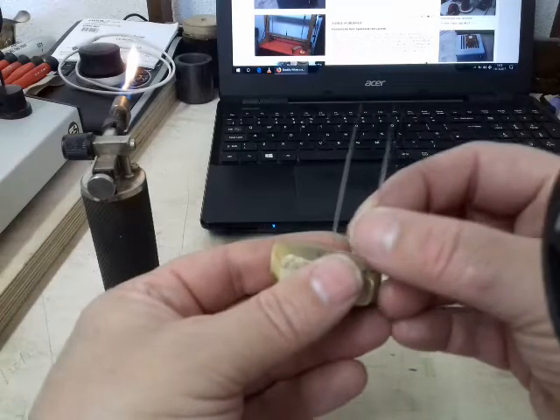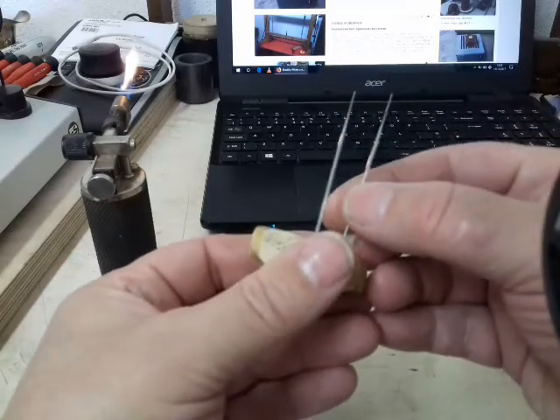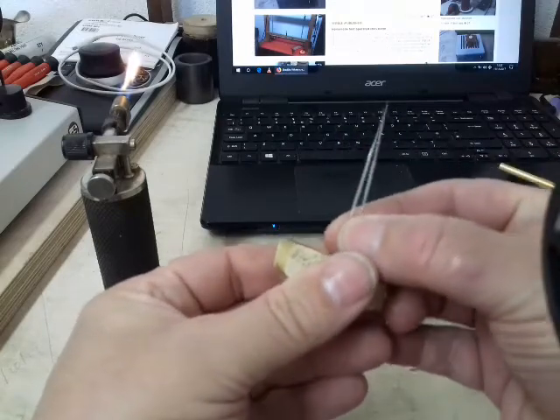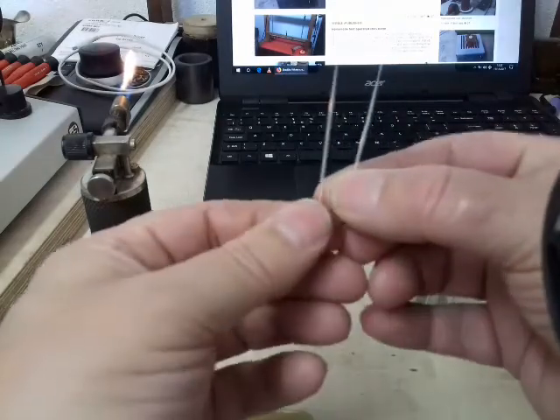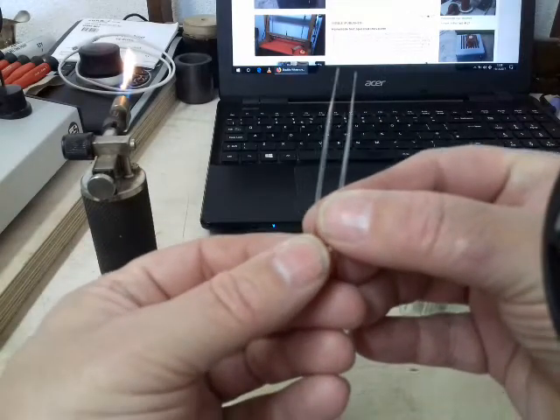Hi folks, that was a short demonstration to show you how I make my pipettes for the artificial insemination of queen bees. As you can see there, I have two nice needles to use and trim down and flame polish for later on.